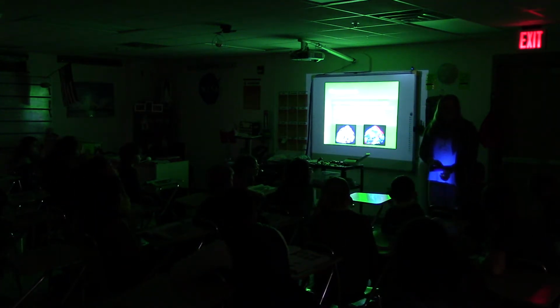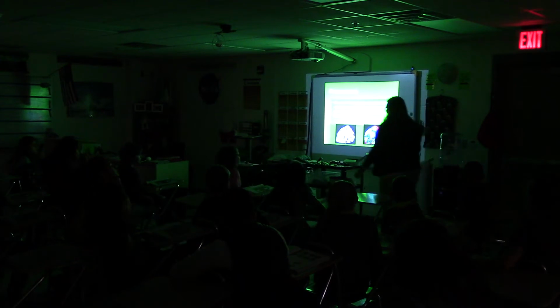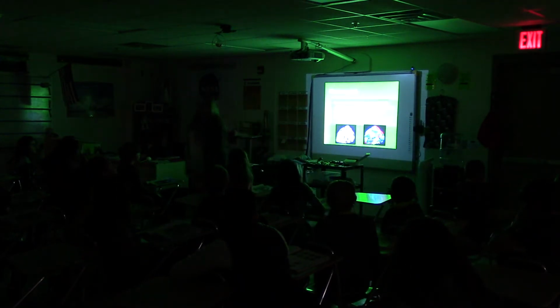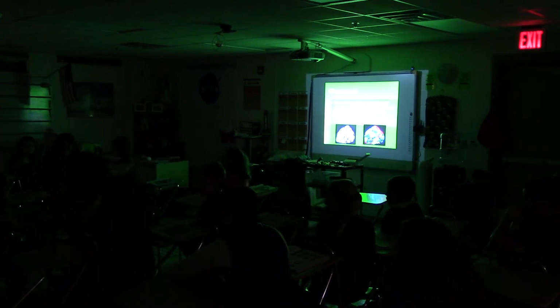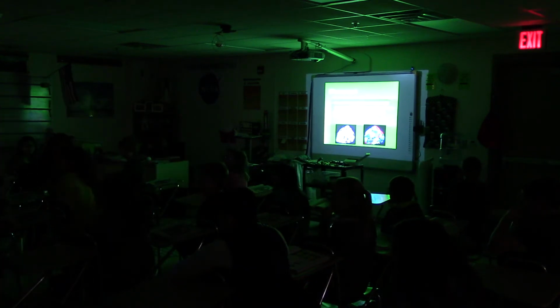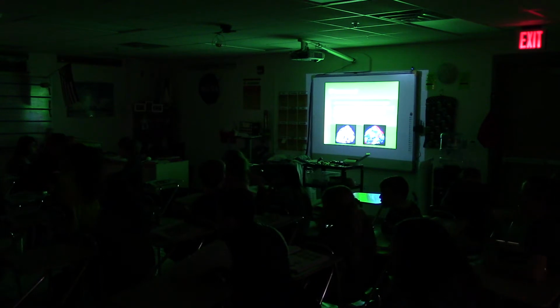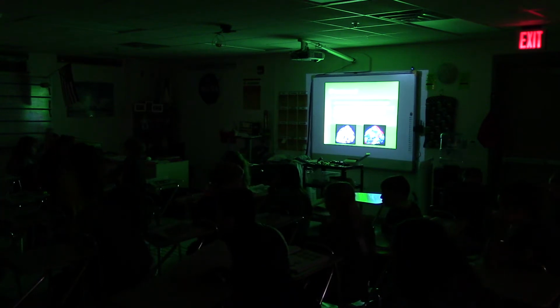So you thought that first one was cool. Oh yeah, this one's gonna be so cool. Oh yeah. Oh, my God. Whoa. Looks like gold. Let's see, orange, black. Let's go down the rows with this one. Gold. I like that gold.